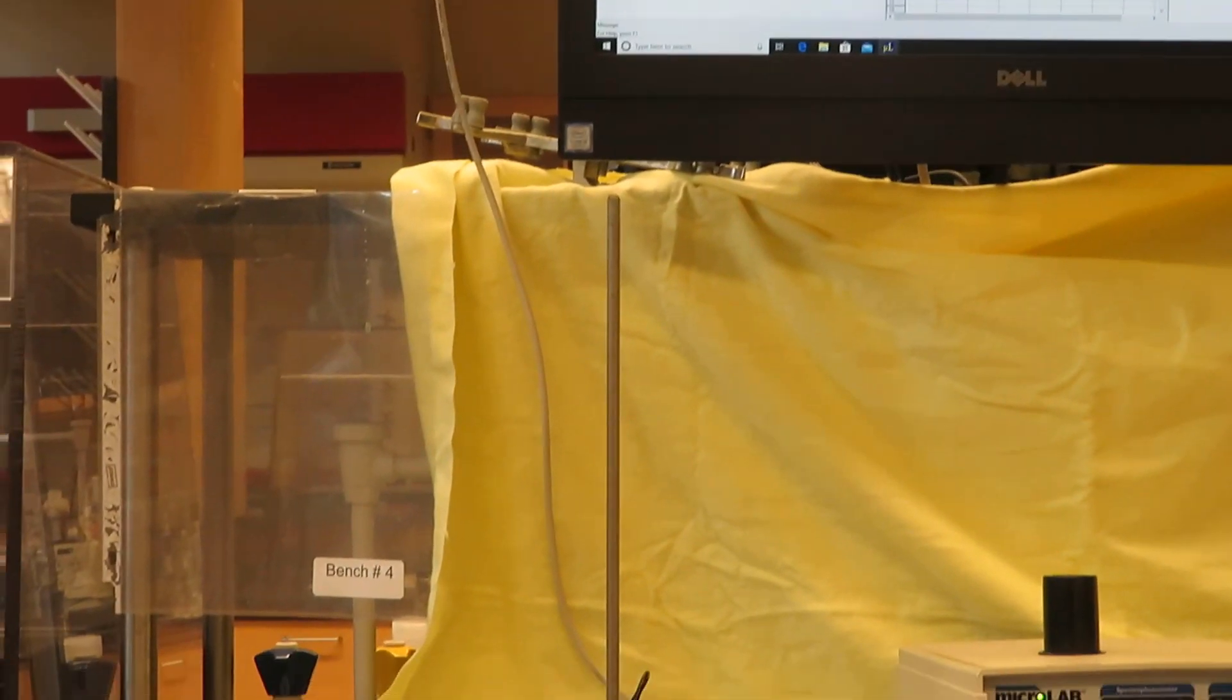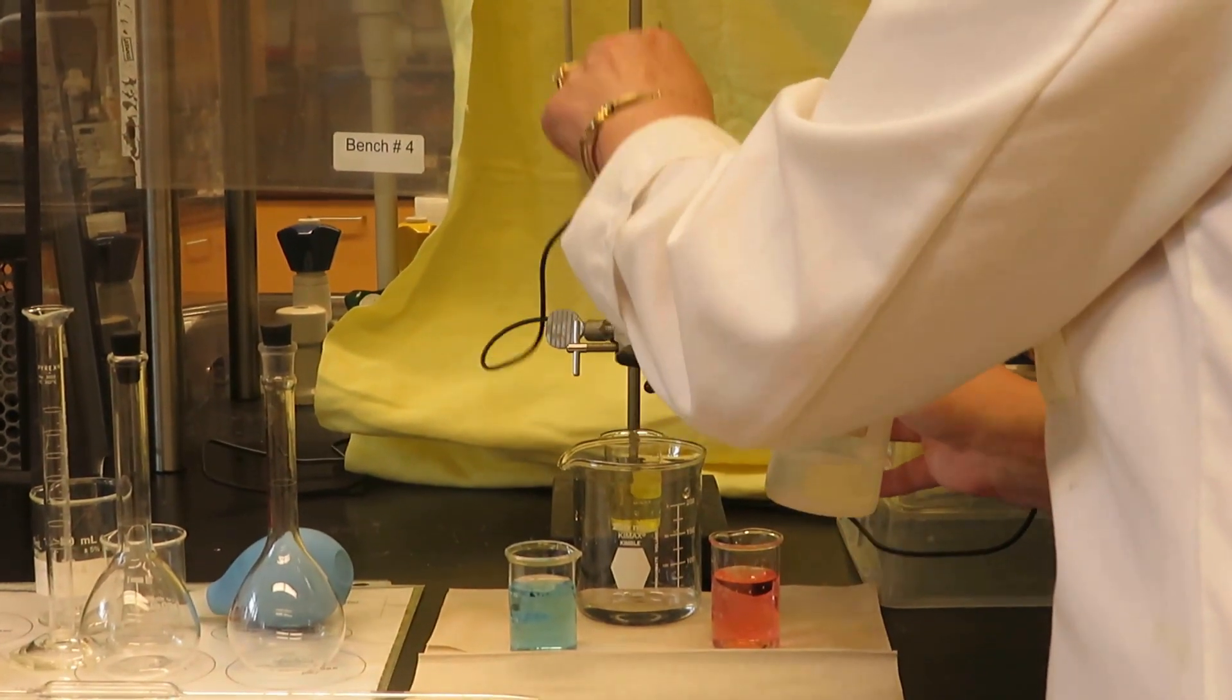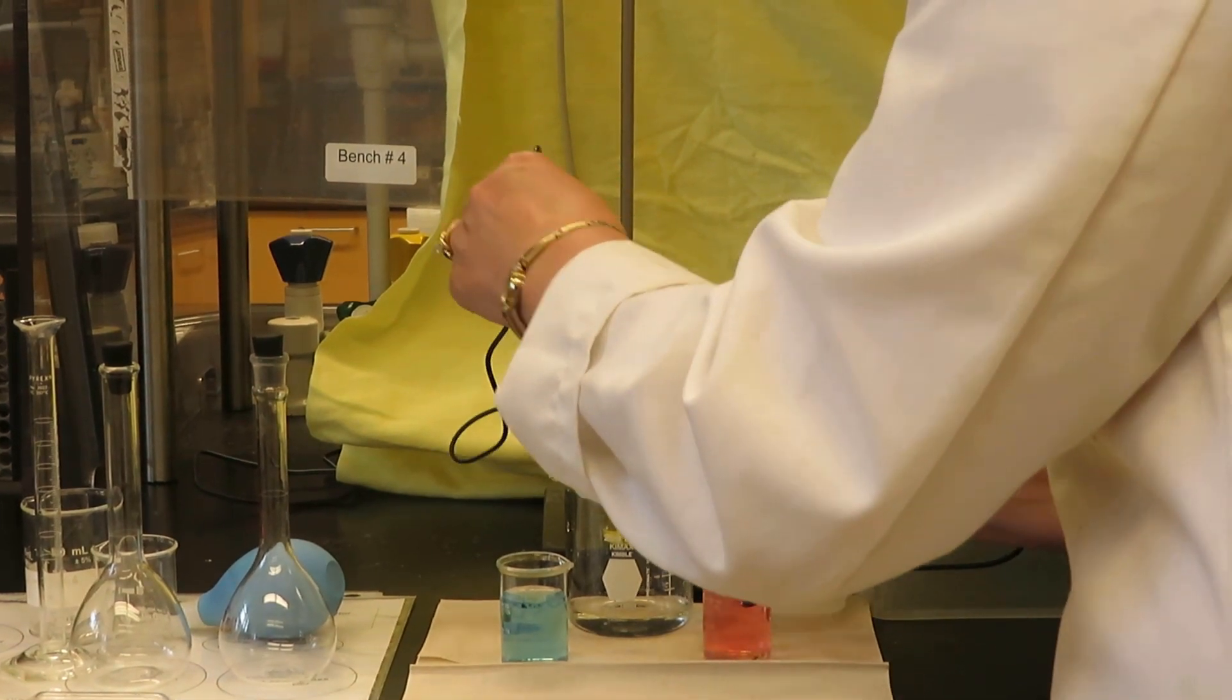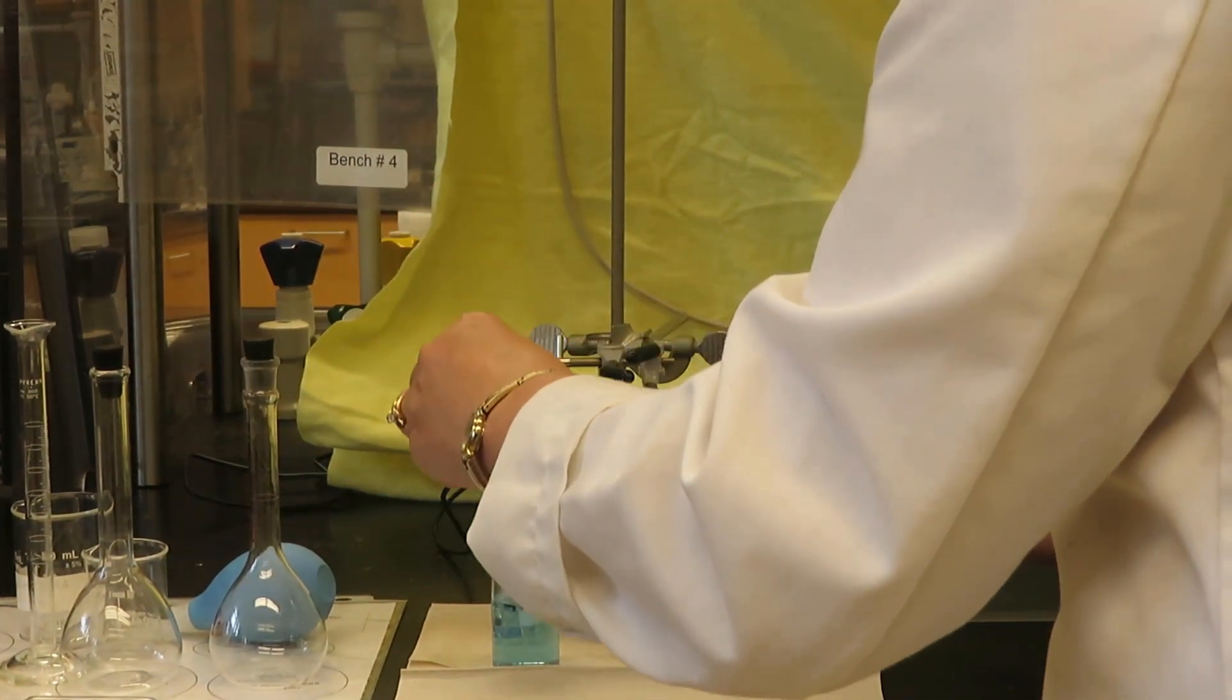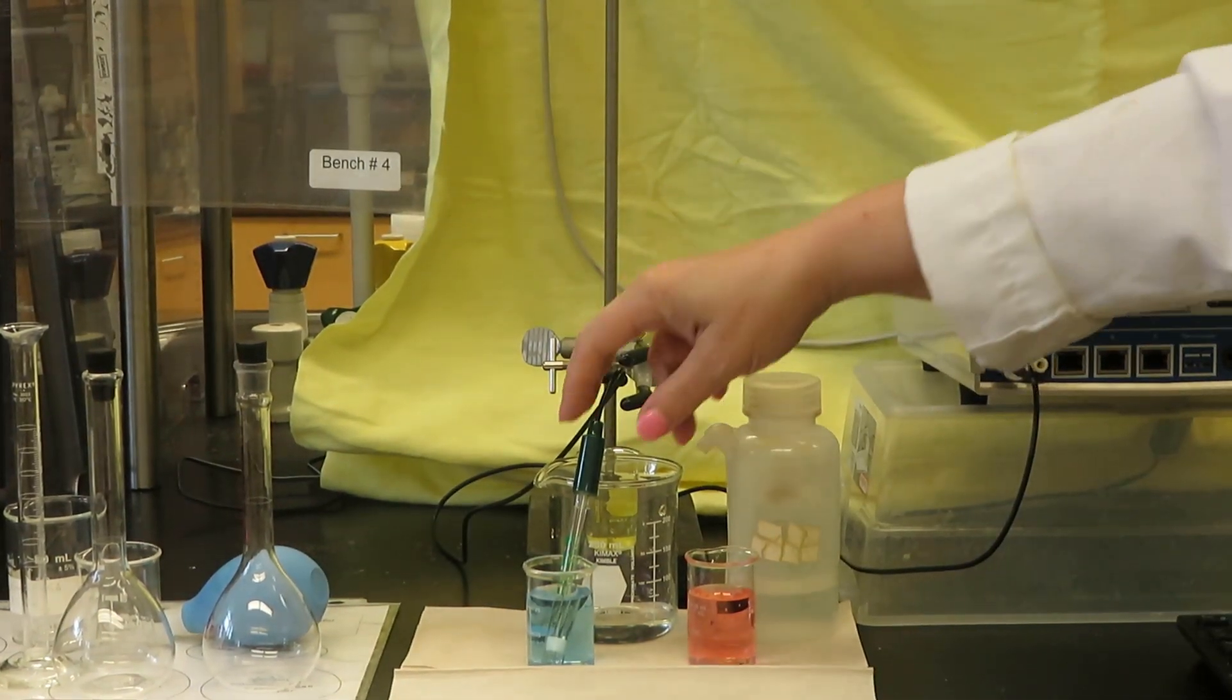We have one last calibration point to add, and that would be the blue solution, which is pH 10 buffer. I'm going to take it off and put it in the pH 10 solution.